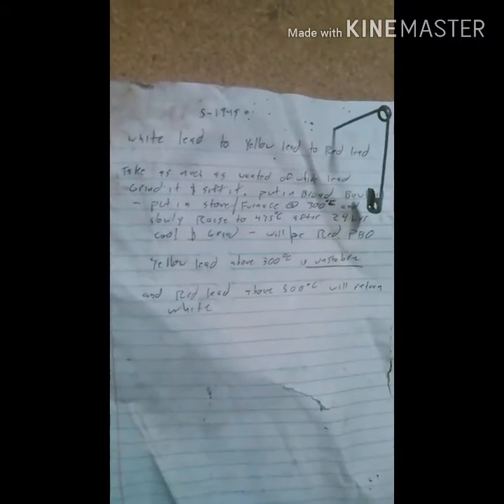Here's a little paper I wrote a while back — it describes how they did it back in the days of old. Pause it here so you can read this. The autofocus on my phone is awful — I wish you could still set your own focus. Anyway, here's my red lead in here.